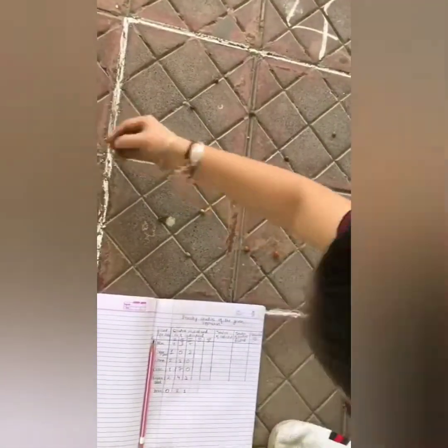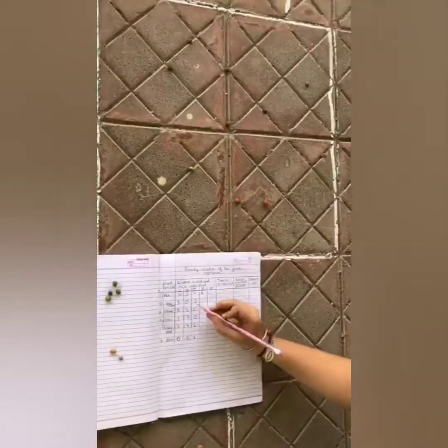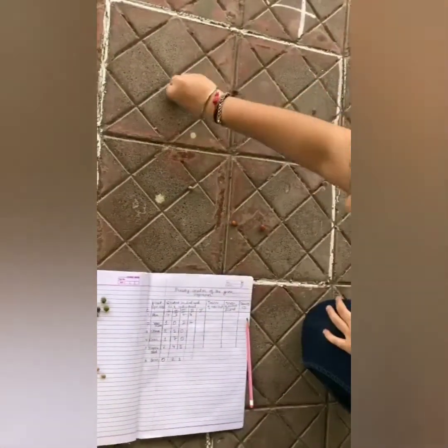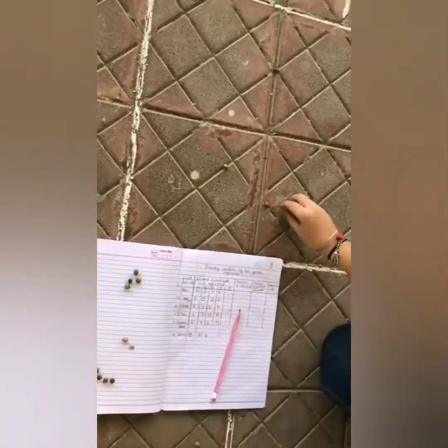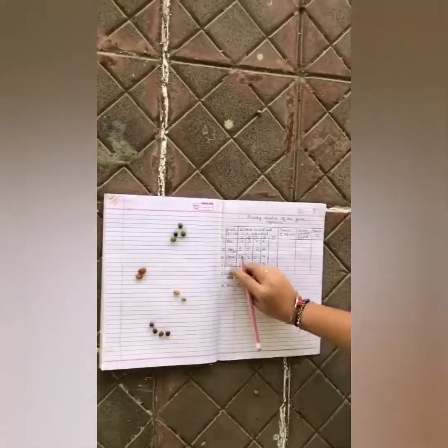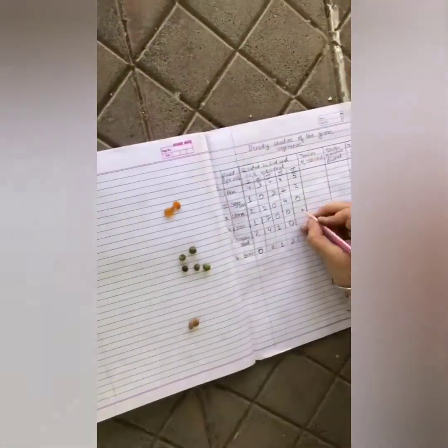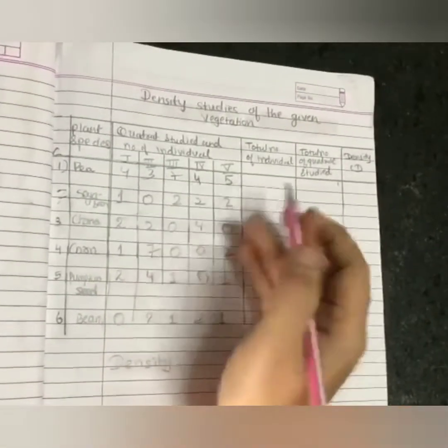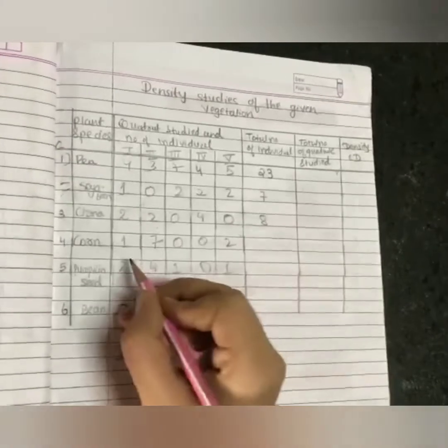Now we will count the total number of different species in Quadrates No. 2, 3, 4 and 5. I am counting the total number of individual species studied across all 5 quadrates.